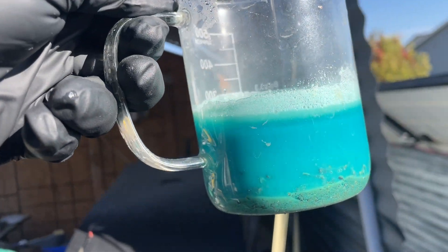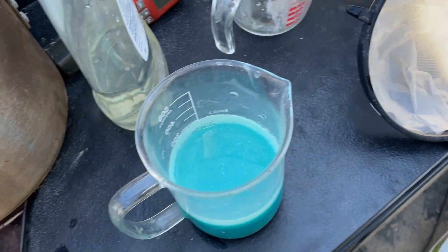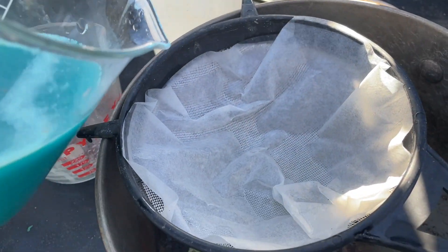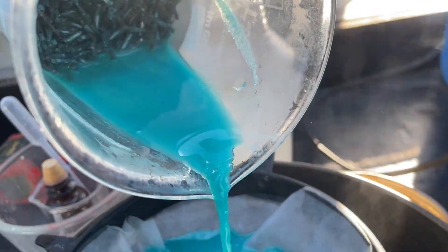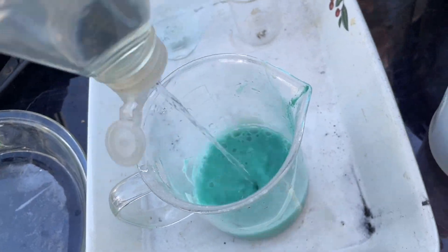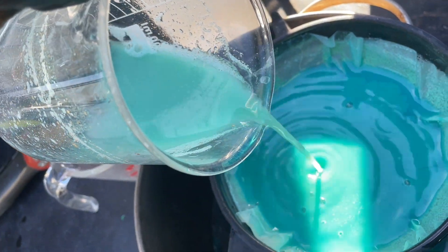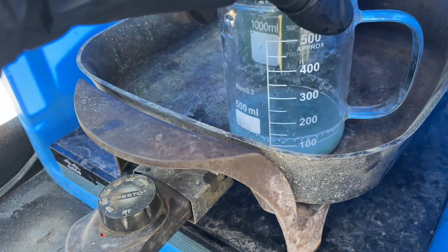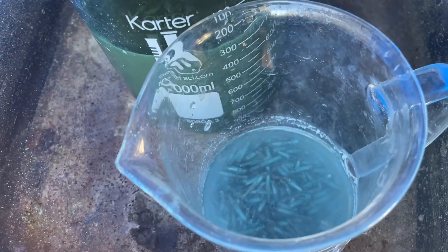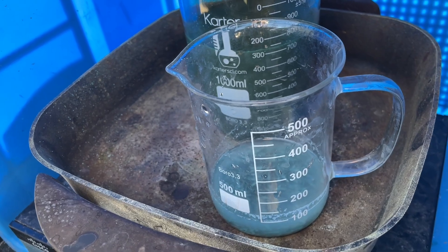It looks a little narrow down there. Anyway, I'm going to pour this material through a filter and see if we got down to the bottom after washing them. Got 100 mL of water back in there and it's rinsed pretty good — you can actually see through it. At this point I'm going to dose it again with nitric.